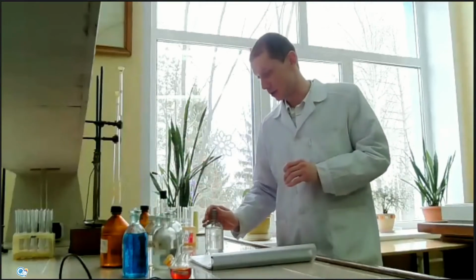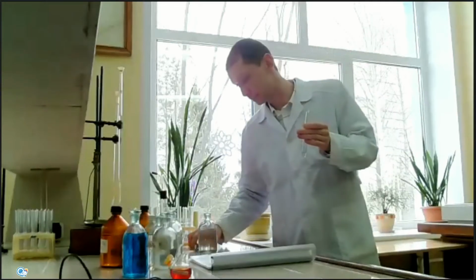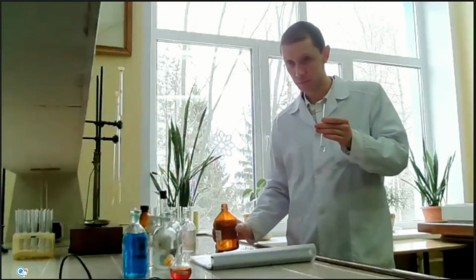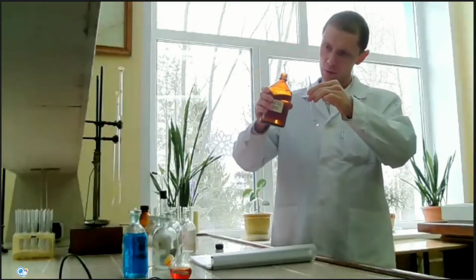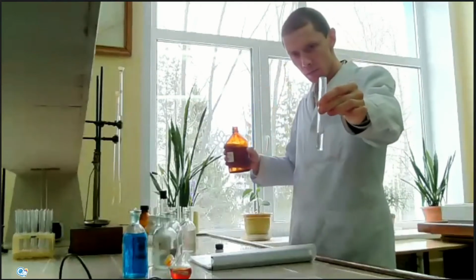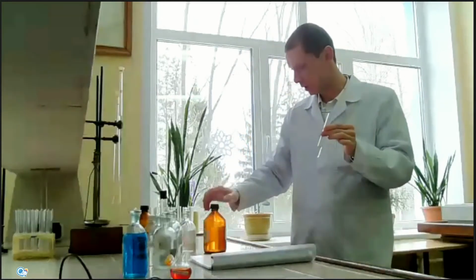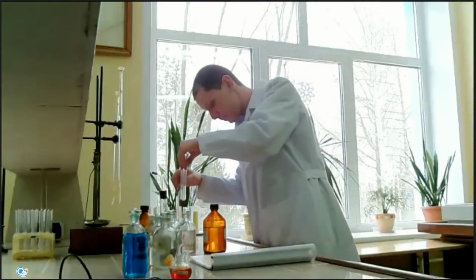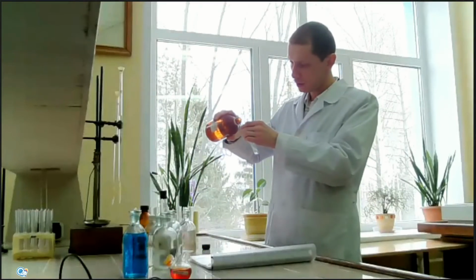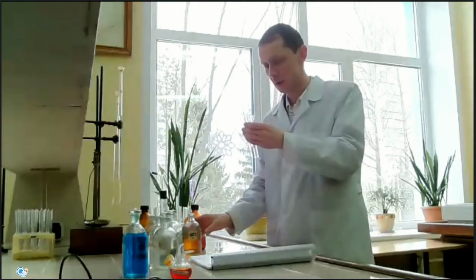Let's mix hydrochloric acid with sodium carbonate. I don't know, will you see the product of this reaction, but let's try. The product of this reaction is some bubbles. Let's repeat this experiment. Maybe I will use 2 tubes. In one tube, I will add sodium carbonate. In another tube, I will add hydrochloric acid. And we'll repeat this experiment near the camera.